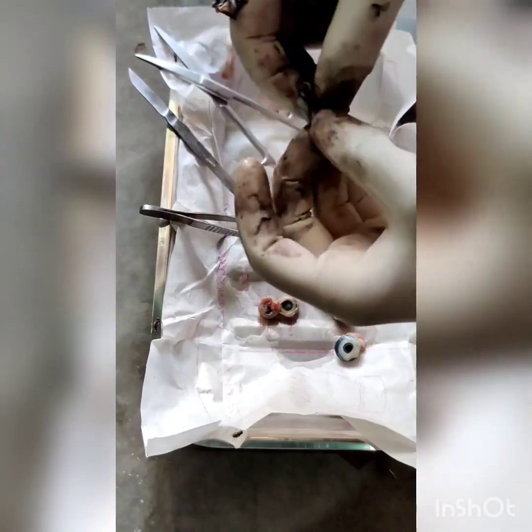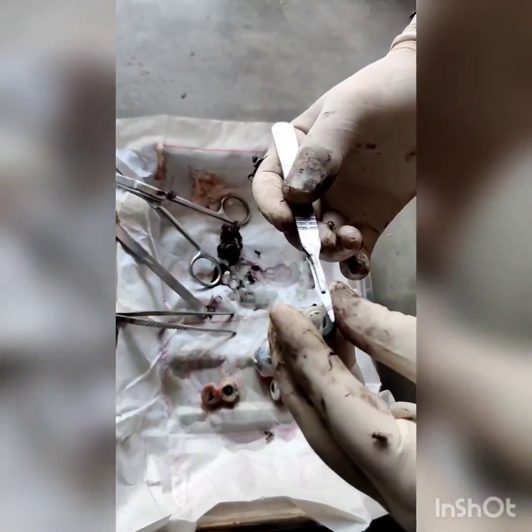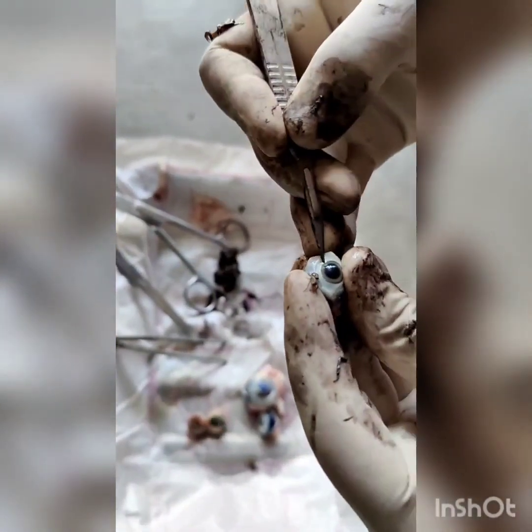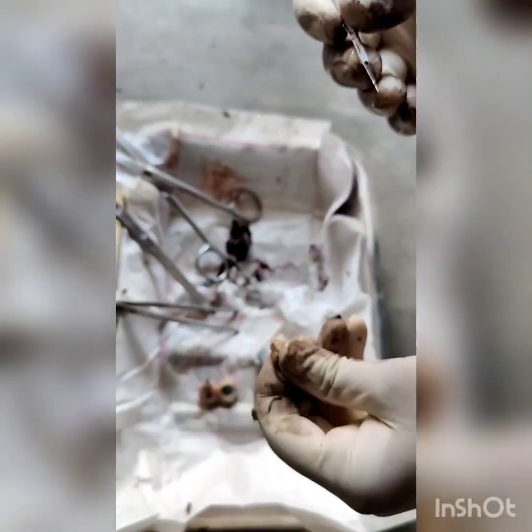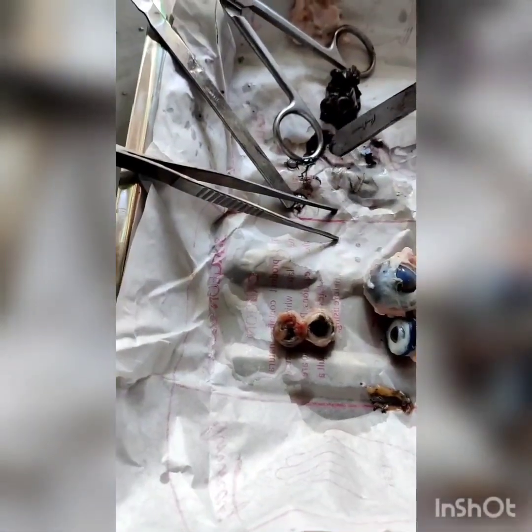Now I am holding the eye of the chicken. The whitish layer here is the nictitating membrane, which protects the eye from dust and debris. I am going to cut this to expose the aqueous humor part of the chicken eye. The whitish jelly-like substance is the vitreous fluid, and the other fluid is the aqueous humor. The aqueous humor consists mainly of glucose, amino acids, and ascorbic acid. The vitreous is composed of water, salts, glycoproteins, hyaluronates, and fibrils.